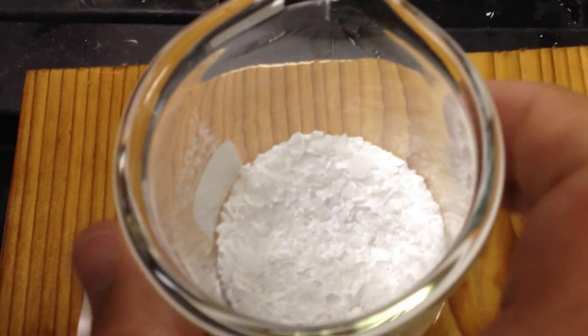Did I pour in the same compound? Hope not. That would really stink. Yes, I did. I didn't grab the right two.